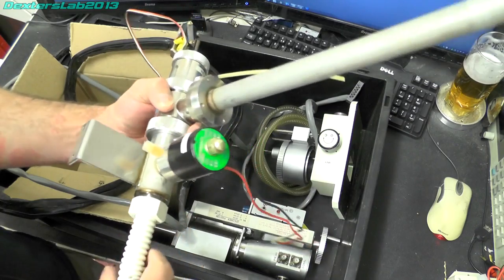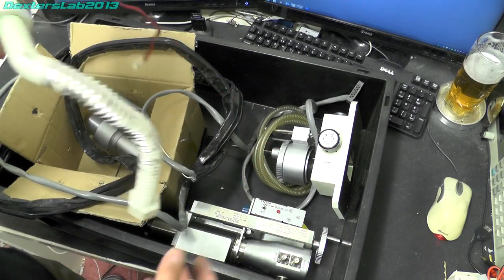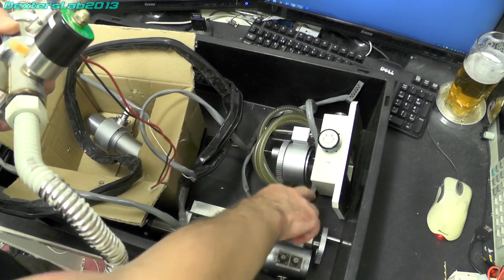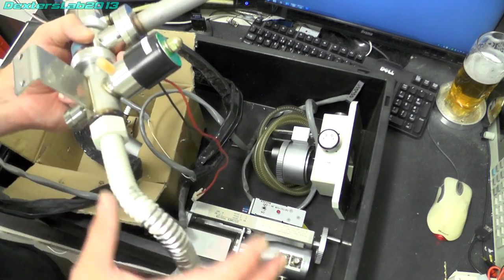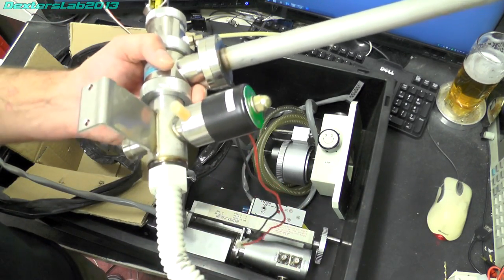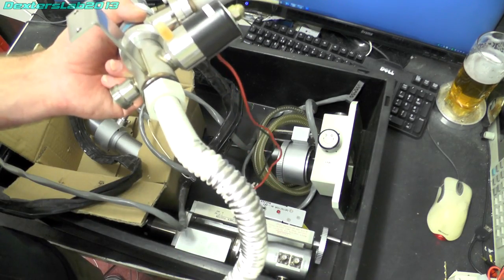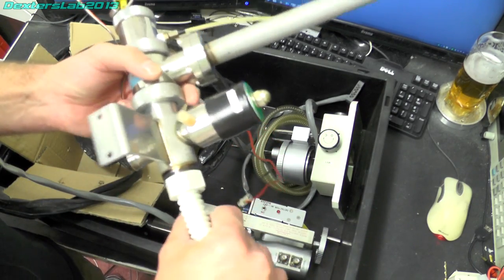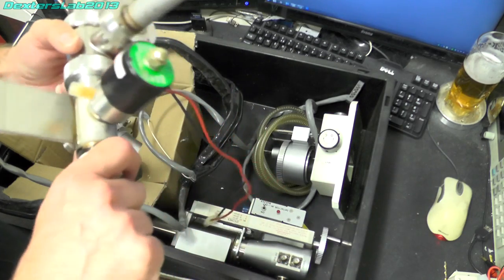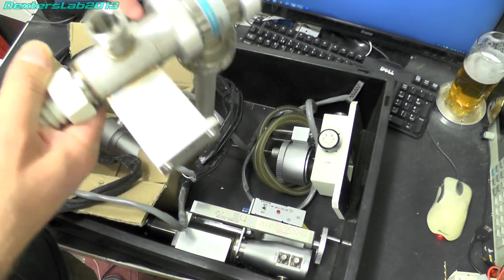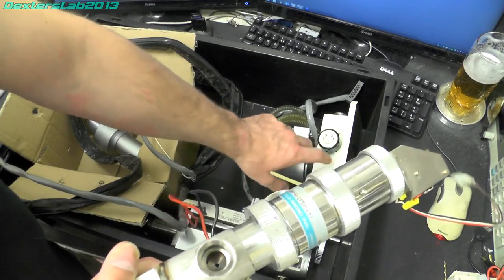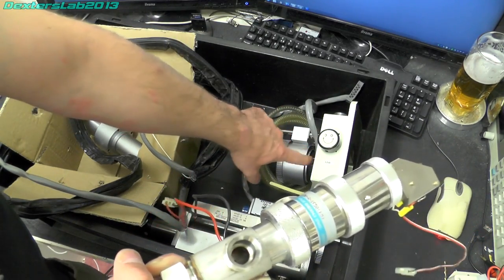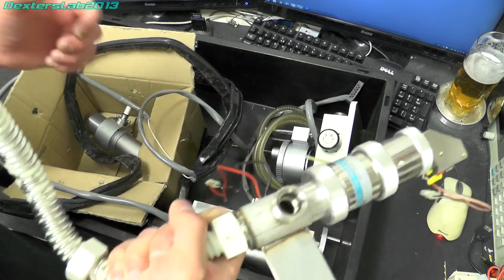This valve and pipe arrangement here is part of the airlock system which is this here that allowed you to exchange samples in the main chamber without losing the entire vacuum in the sample chamber. So it was an airlock arrangement, this worked with this door here to reduce the pressure in this small chamber so you could exchange the sample.